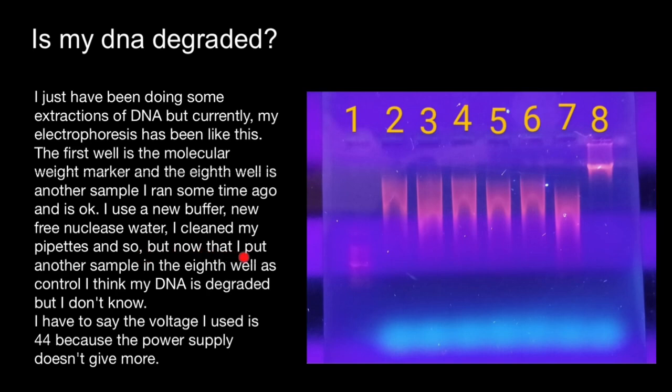But now that I put another sample in the eighth well as control, I think my DNA is degraded, but I don't know. I have to say the voltage I used is 44 volts because the power supply doesn't give more. In well number 8, we see a well-defined band, but in the rest we see that these wells are overloaded and there are a lot of impurities here, and my suggestion would be to repurify the samples.